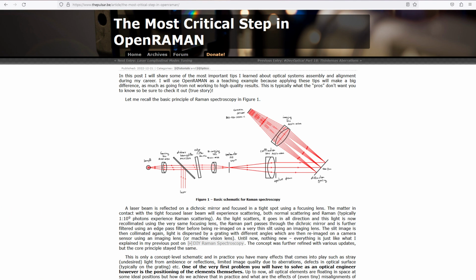So a few weeks ago, I made a post on what I consider being the most critical step in aligning a Raman spectrometer, and that is getting the correct laser alignment with the spectrometer. That's really the thing that can make the difference between a working spectrometer and something that doesn't work at all. And you've been many to struggle with this issue, so I decided to make this video to really go through the complete process of laser alignment in detail.